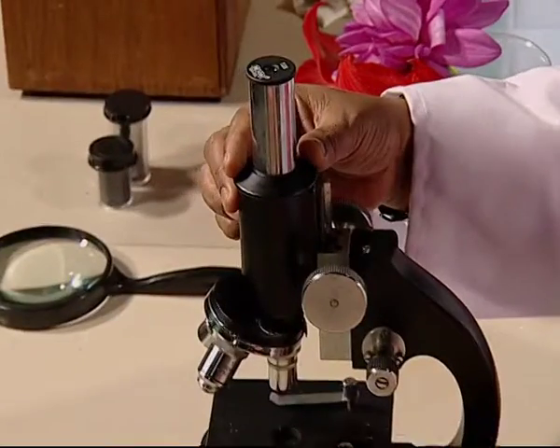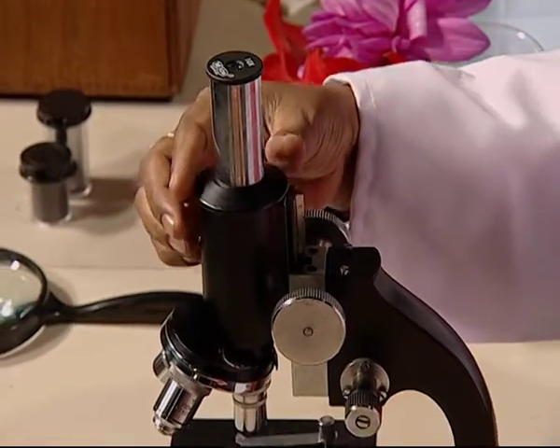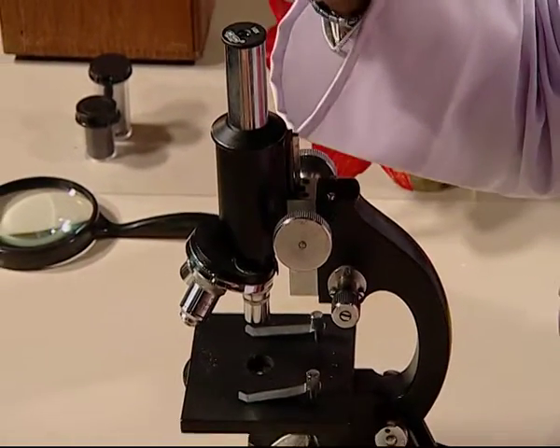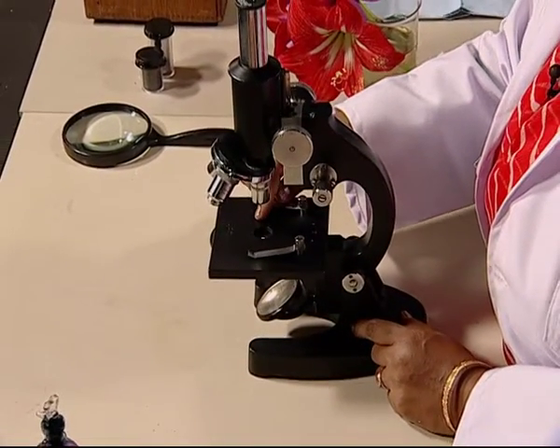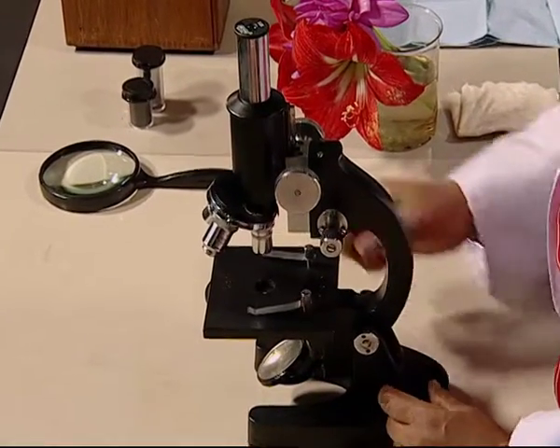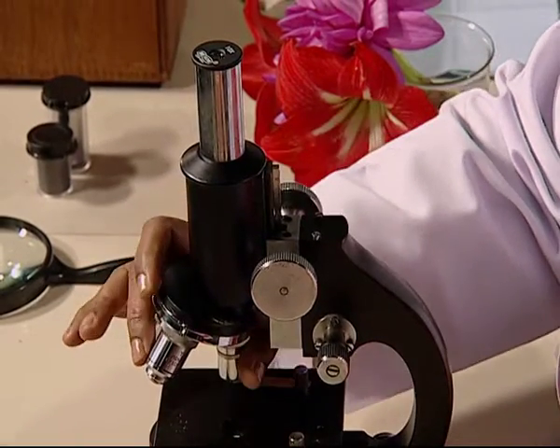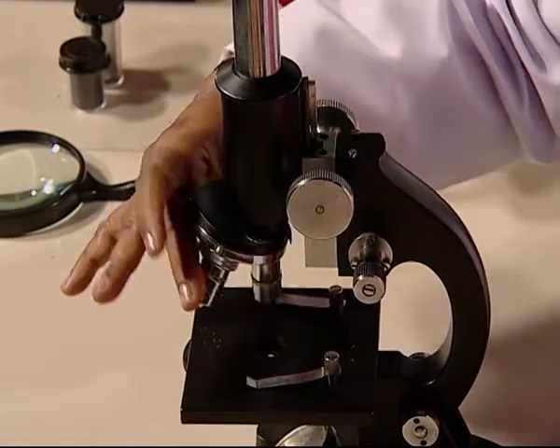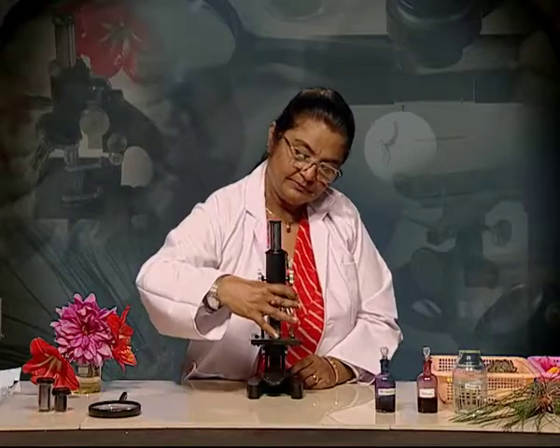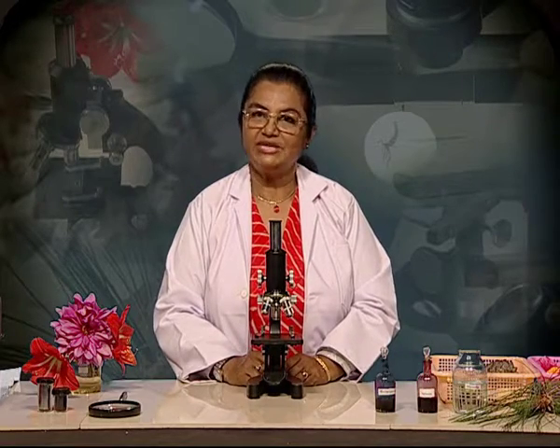The second part that we move on to is the body tube. When we use a microscope, we look down through the body tube all the way down till the slide. The third part is the revolving nose piece. The revolving nose piece has got objective lenses, which are in short called objectives.